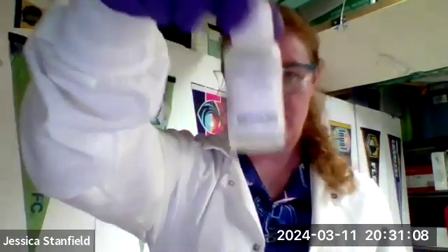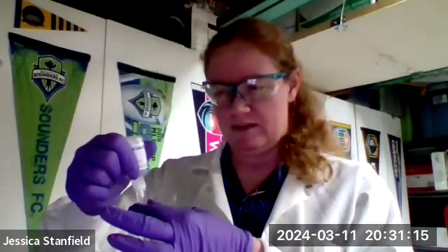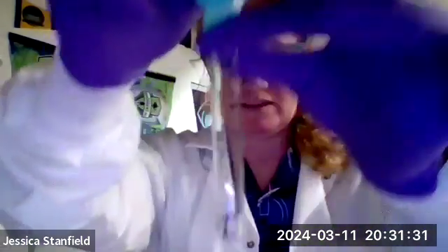Let's see here. Oh, carbonates. Those are pretty cool. Let's see here. I'll start off with some sodium carbonate. Put some of that in here. Okay, and now I'm going to take that copper(II) chloride again. We should get kind of a funky blue precipitate.